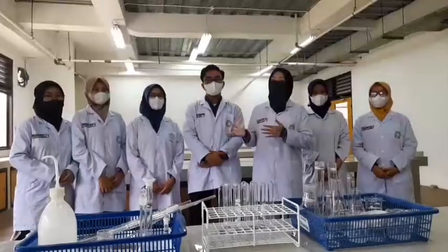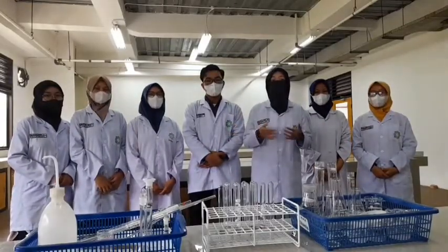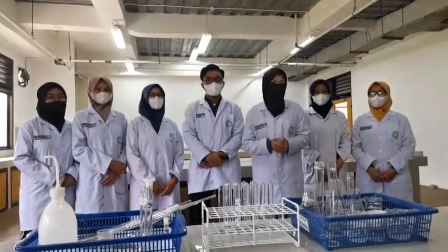Today, we, Group 4, will explain and introduce laboratory equipment.